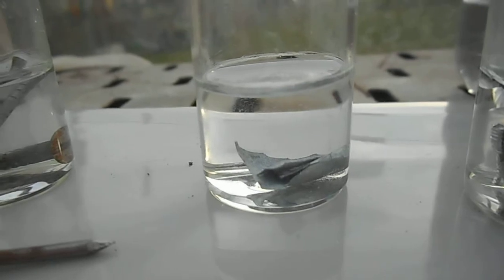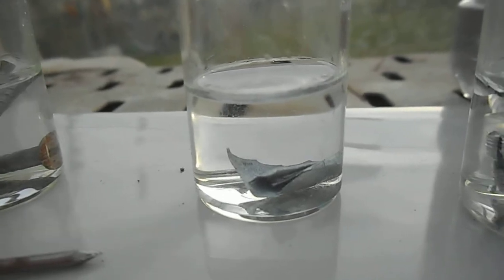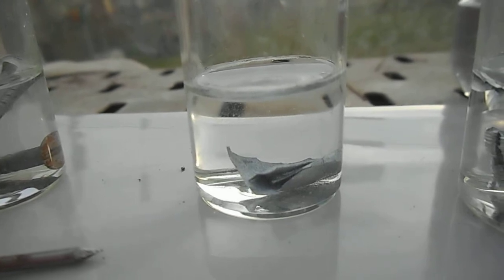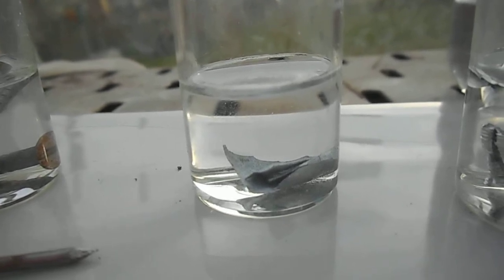This one is zinc and you might be able to just detect the slow evolution of some very small bubbles on the surface of the zinc rising to the top there.